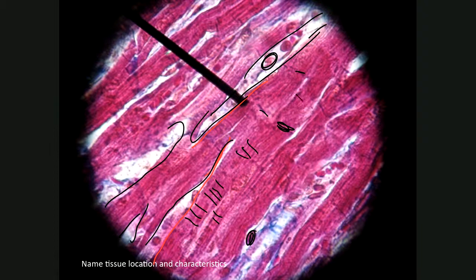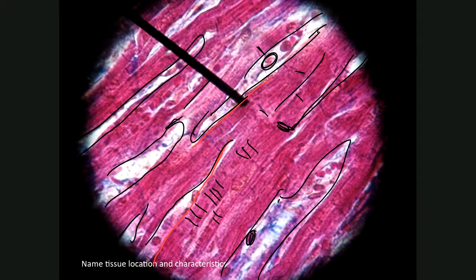So what we don't see in connective tissue, first of all, we don't have it in a close-up like these. We typically see a broader part of the tissue. The cells of connective tissue are small. These pink structures are cells themselves. So these entire pink structures are going to be cells. So that leaves us with elongated cells. There's only one tissue that has these elongated cells that have lines running through them, and that's going to be muscle tissue.